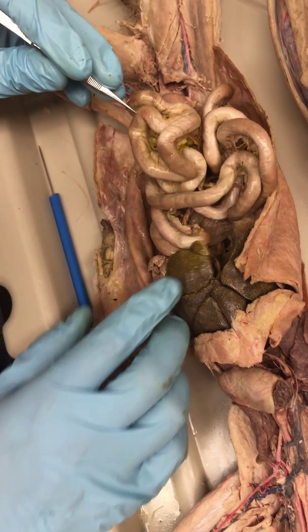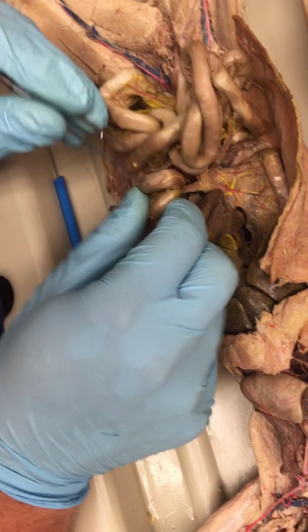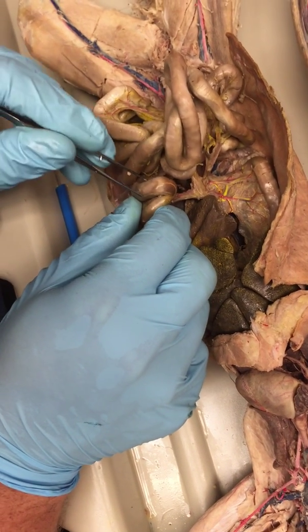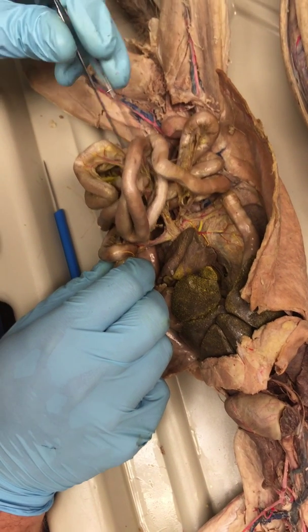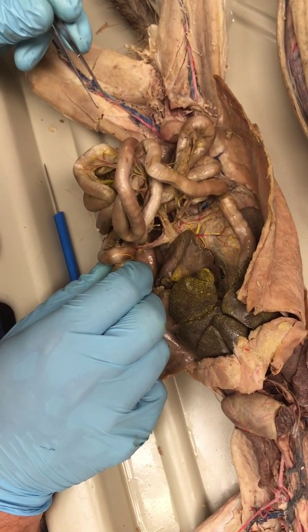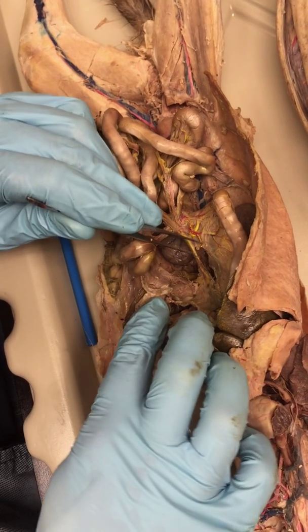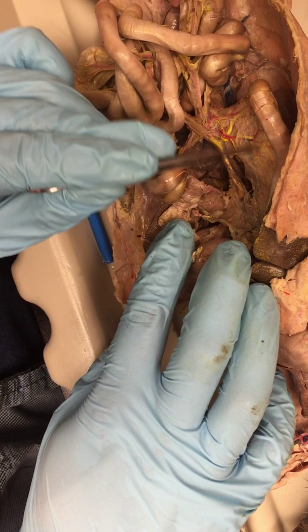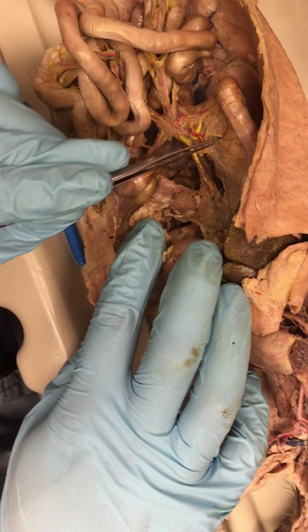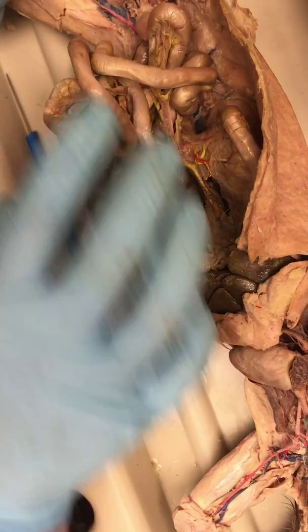And so if I was going to test on the different portions of the intestine, I would test on the ileum right here where it connects to the large intestine, the duodenum right here where it connects to the stomach, and the jejunum all the way in the center. Well, we're not done yet. What about the pancreas? The pancreas has 2 lobes, the gastric lobe and the duodenal lobe, which you'll find the posterior pancreatico-duodenal artery and vein inside. We'll get to that in just a moment.